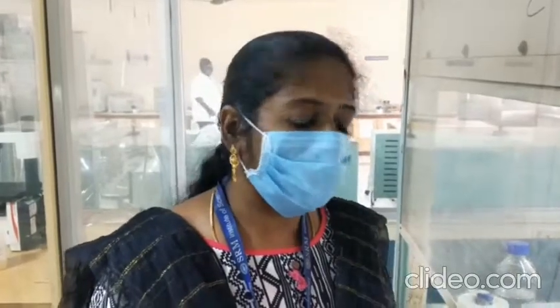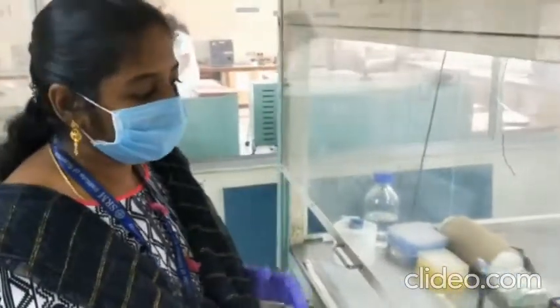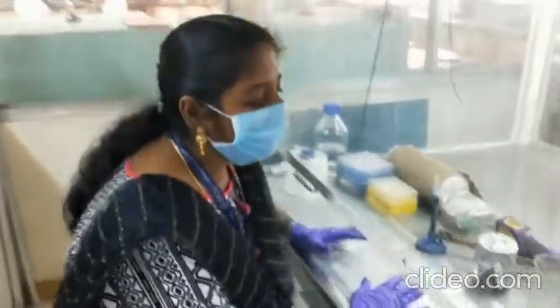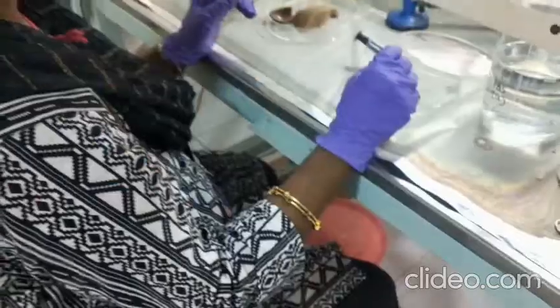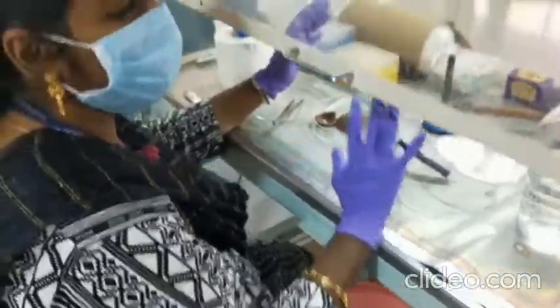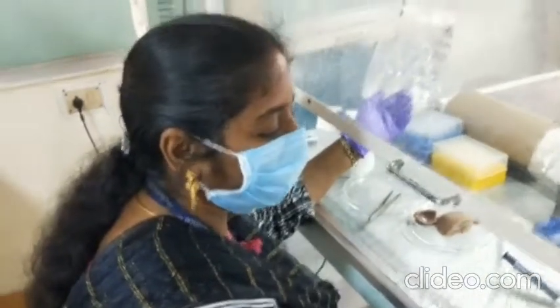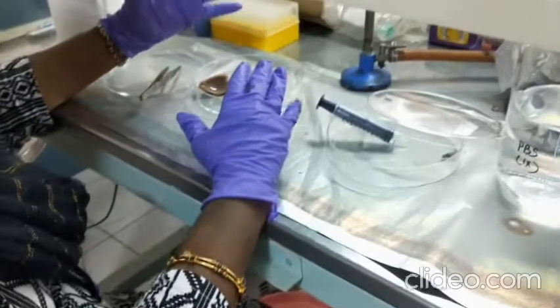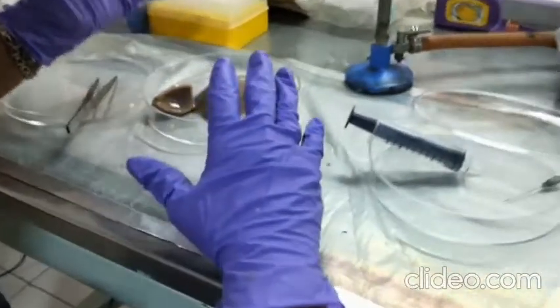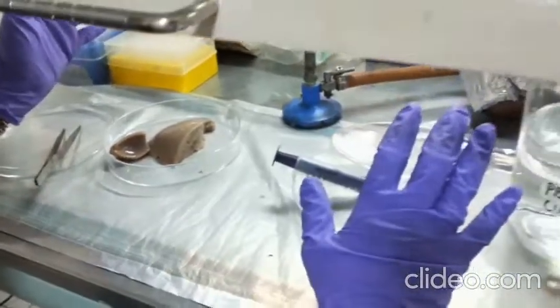To begin with the isolation of hepatocytes, we need a sterile laminar airflow, a Bunsen burner, and all procedures must be carried out in a sterile environment. This is the setup required. We have freshly procured liver from the butcher shop and all equipment is sterilized.